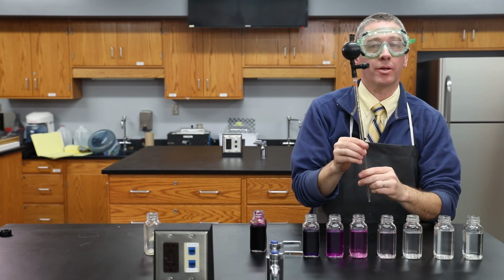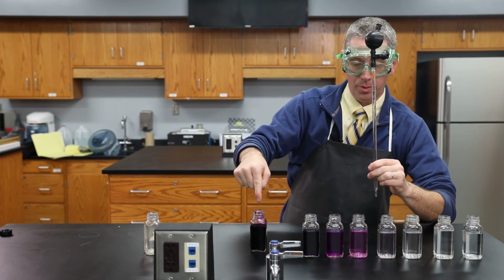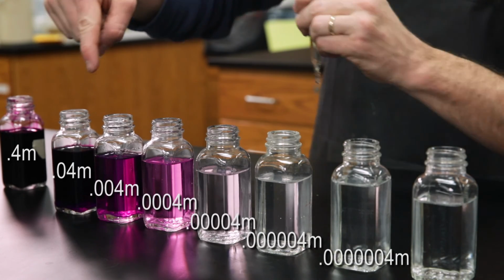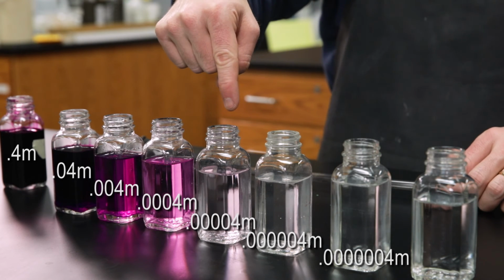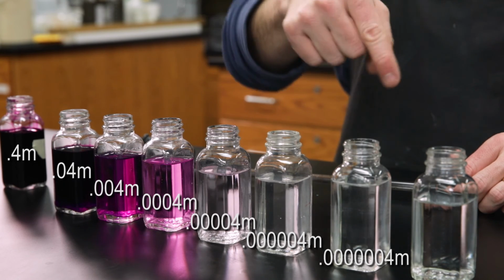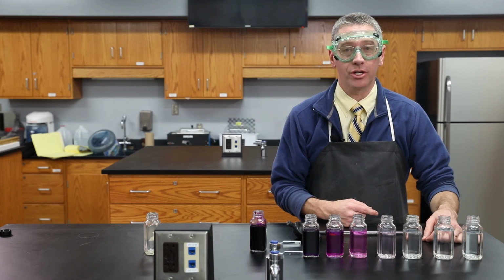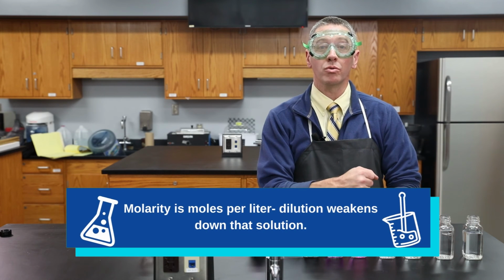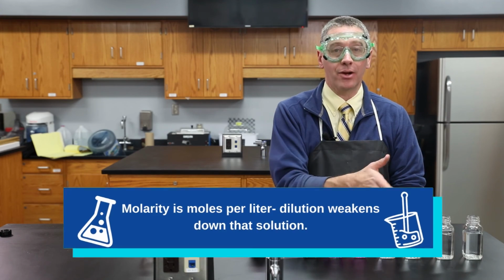So to do that, we've used a pipette, which is just a finely graduated straw. We started at 0.4 molarity. This is 0.04, 0.004, 0.0004, and so on, with more and more zeros. I think if we transferred it one more time, you would not see any color change at all. Molarity is moles per liter, and dilution is just weakening down that solution.